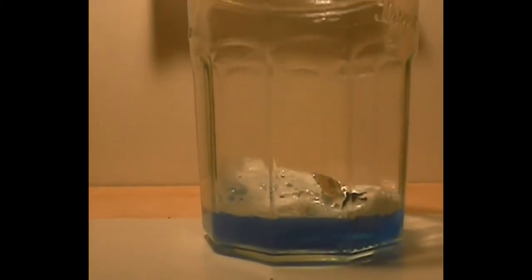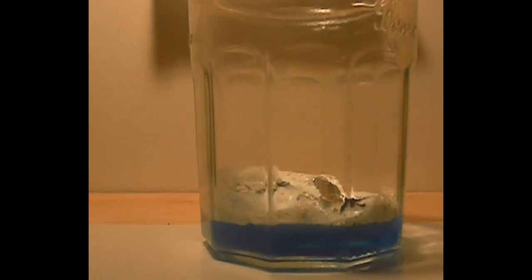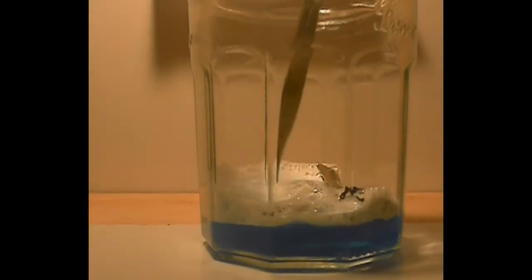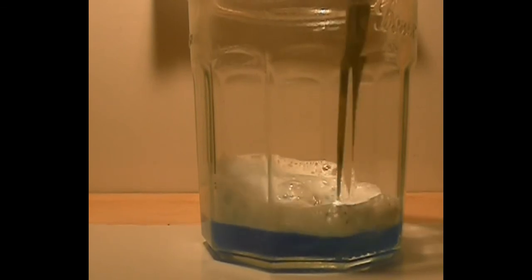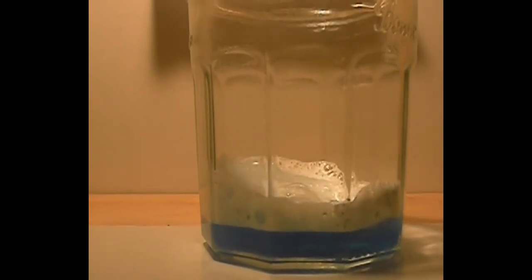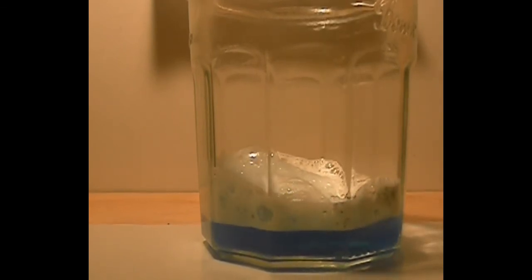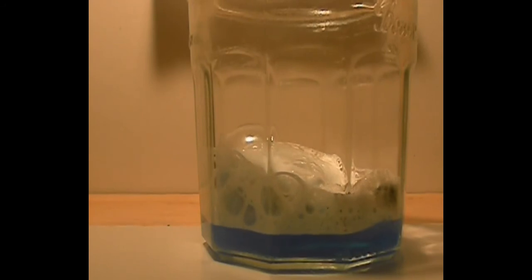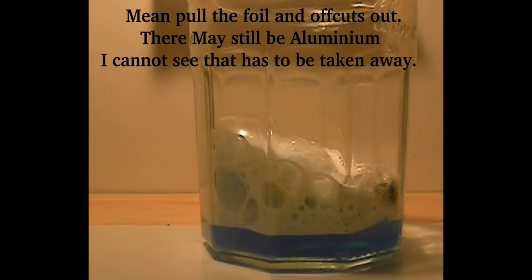All bubbling away, all the hydrogen's coming up. I can see the hydrogen, it's a lot. Yeah, so after this I'll make another video putting a flame under it, getting rid of all the unwanted stuff. But the aluminum will still be there, I'll try and pull it out if I can.